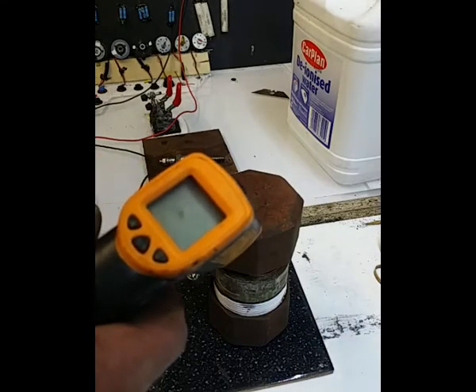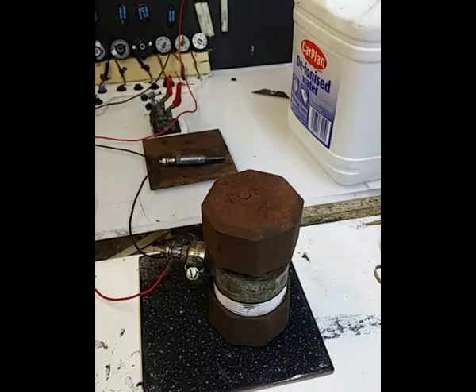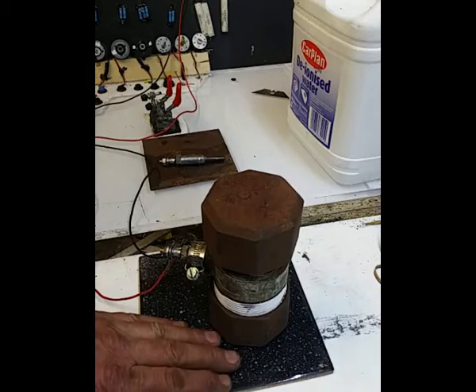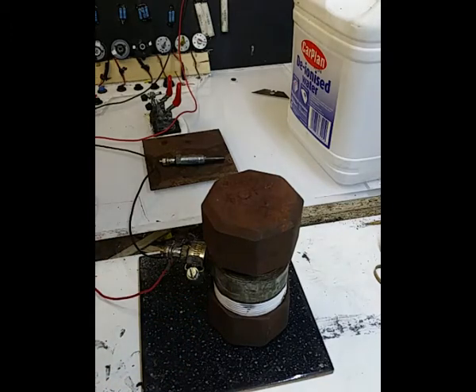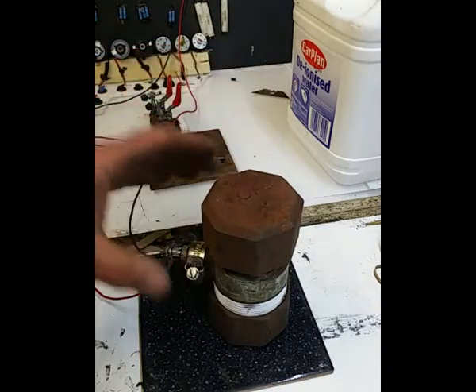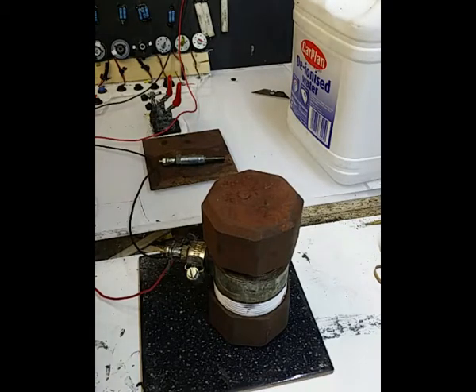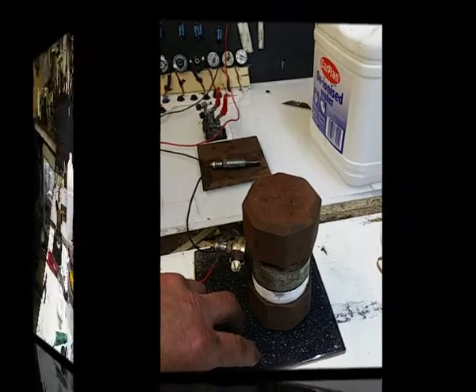So what I'm going to do now, we're still at 88, so I'm going to leave that for, let's say, half an hour, and I'll come back after half an hour, see what the temperature is, and if it's regulated itself to 88 degrees, what I'll do then is turn up the voltage to maybe 8 volts, and we'll see what the temperature is then. So I'll pause the video for now and just leave that for half an hour.